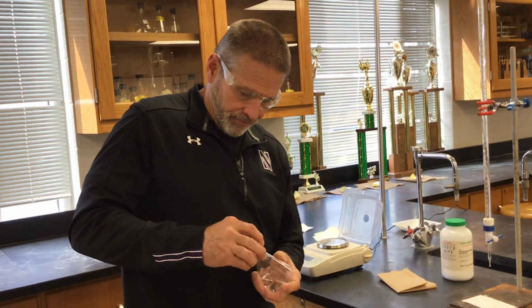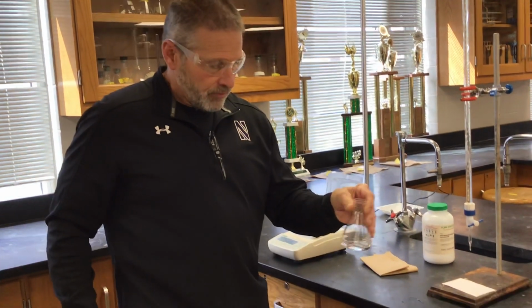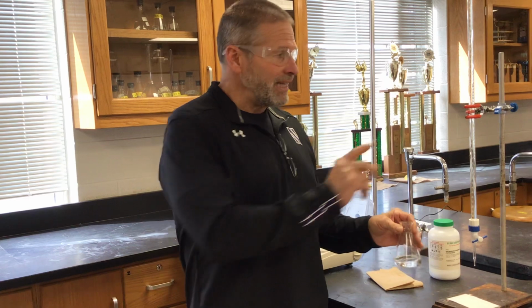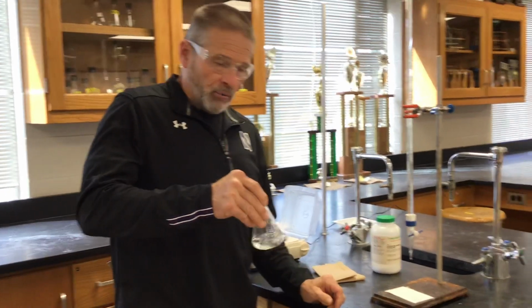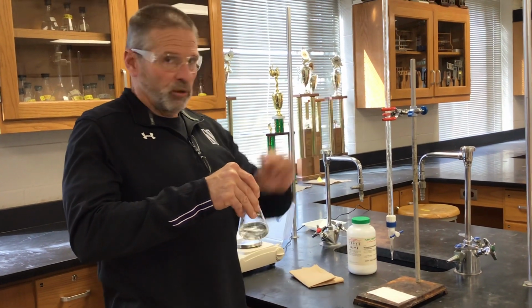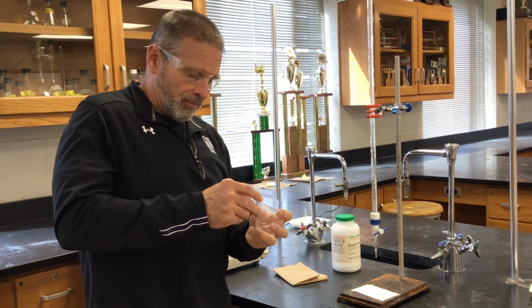So what are we looking for? How do we know when we're at the end point? If that was sloppy, what are we going to try to do now? Right, so now we're going to try to catch the drop that turns this a light pink and keeps it pink. And once I hit that point again, I know moles of acid here, which I can calculate, are equal to the moles that I've added from my burette.